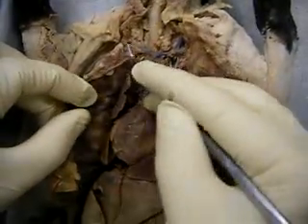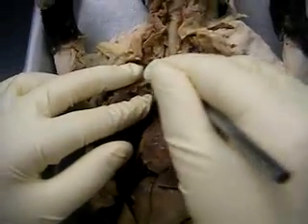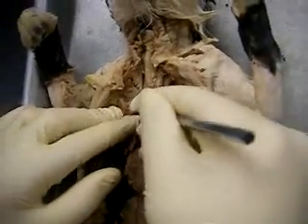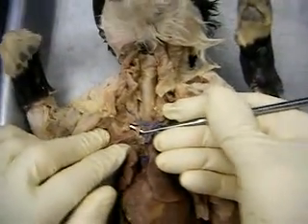So this is one of the external mammaries. And you can see it's going to feed the breast tissue, okay? And I'm trying to find the vertebral. The vertebral one is going to follow the vertebra. And that looks like that pink one right there. That's going to come out the top of that subclavian, okay?